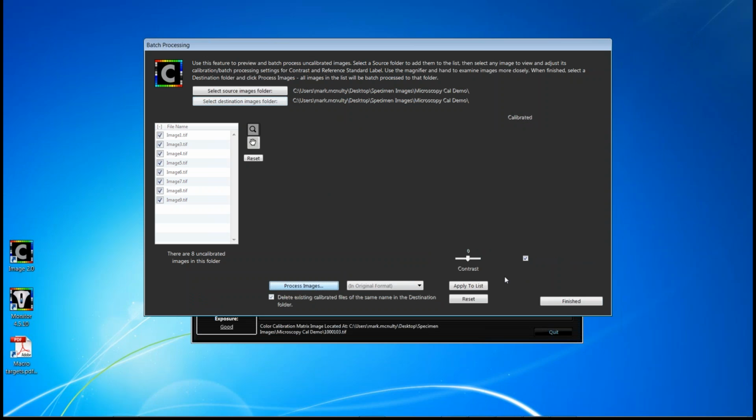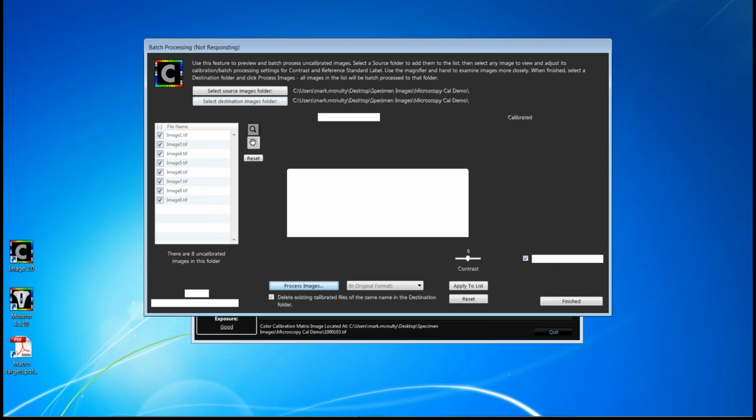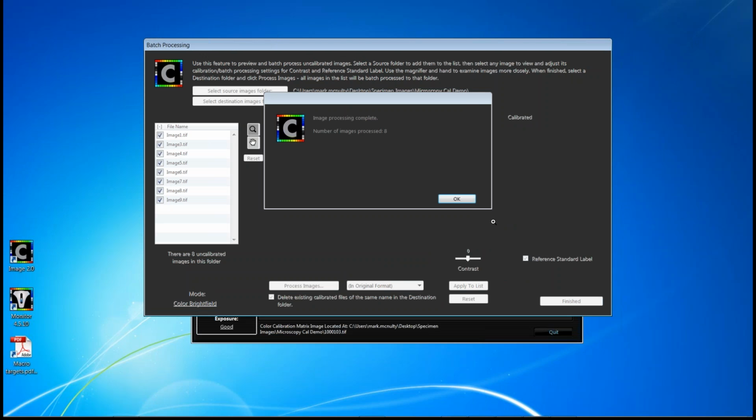And what CHROMACAL will now do is go through those 8 images and process and save those 8 images so that you can then view them in really any image viewer. And what people have typically commented on is the time it takes to open up Photoshop, they'll find that the batch process is completed by that time. So very, very quickly they can do a whole boatload of images in just a few steps.